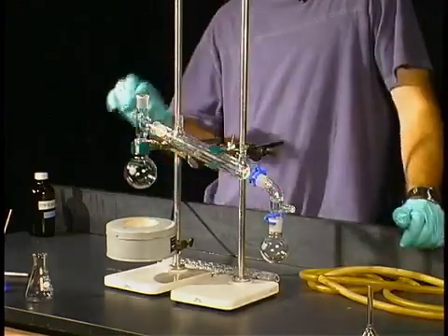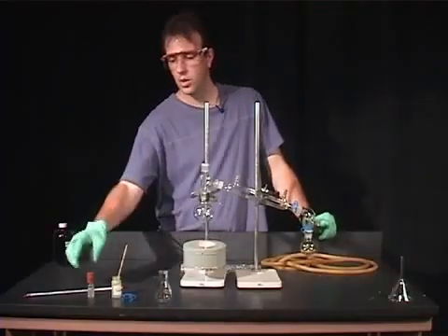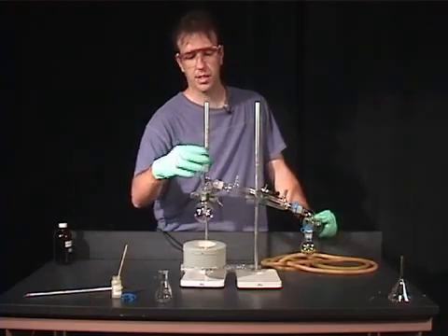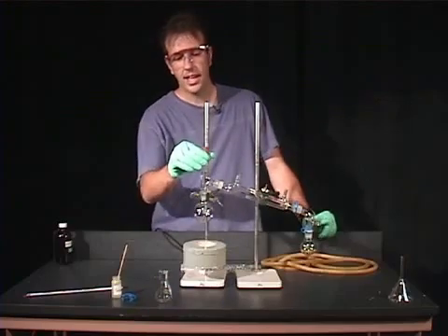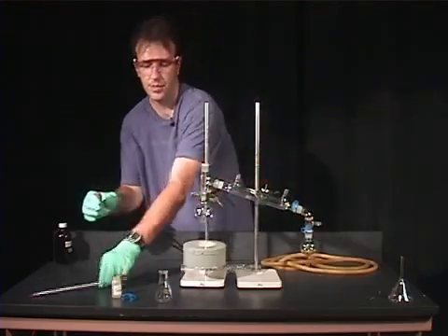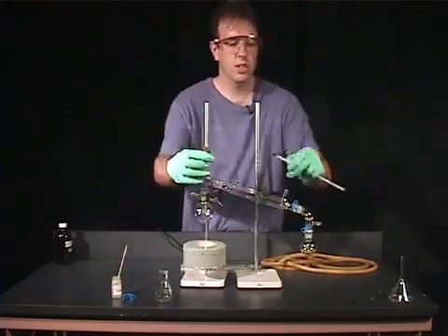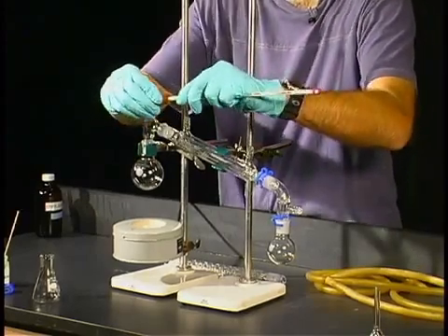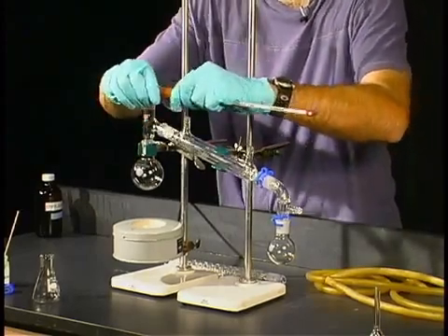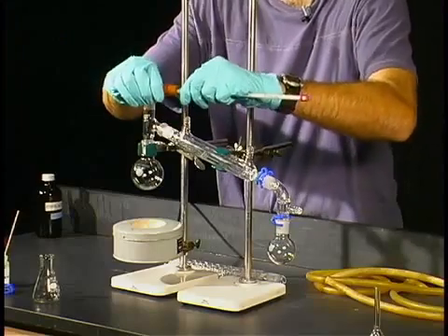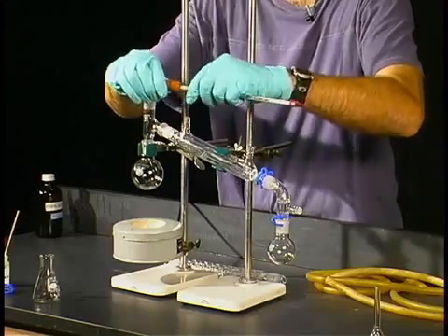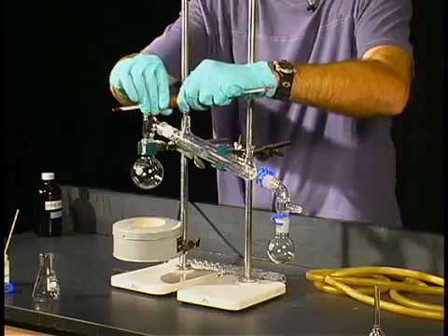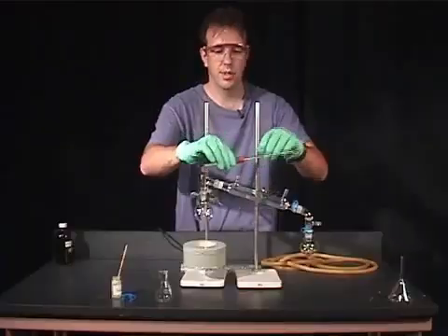One of the last things you do at this point is we're going to add our thermometer adapter in the top here. When you add the thermometer to the thermometer adapter, you want to hold the thermometer as close to the entrance as possible. So you add it in there and just move it a little bit. The closer you are to this joint, it makes it easier to slip this in there. The farther away, you have a possibility of breaking the thermometer and you don't want to do that.